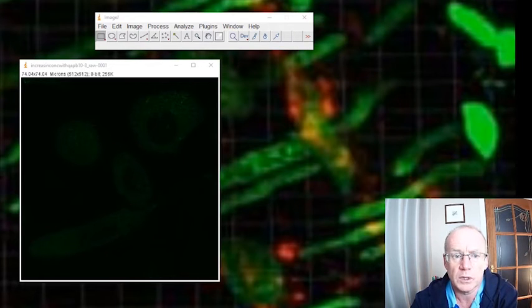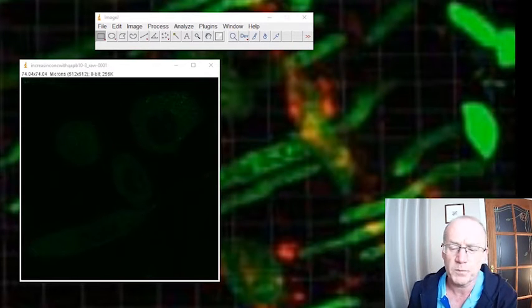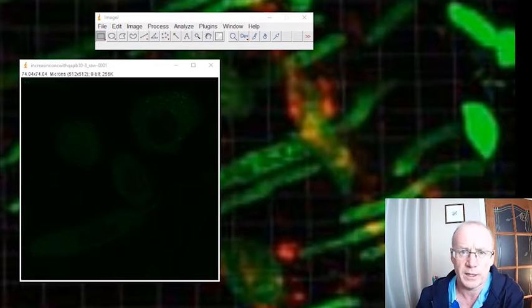What I wanted to do today was just a quick video on background subtraction and three ways in which you could subtract the background from an image. This is related to the previous video that I did, in which we used binary masks in order to extract information from fairly noisy images. But let's say you just had a kind of noisy background and you wanted to subtract that background noise.